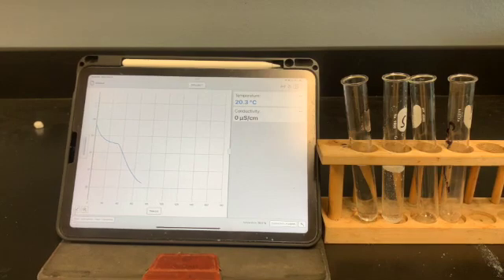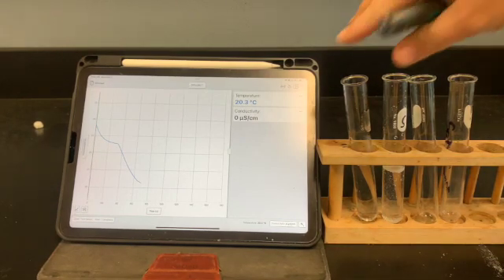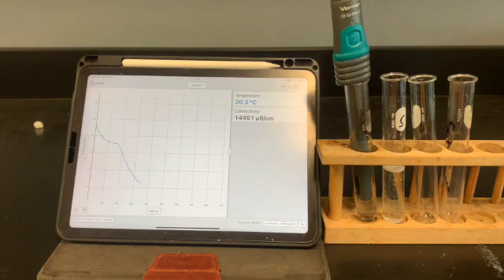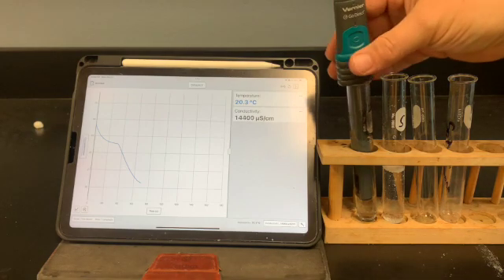Okay, so this time we're just going to get a reading with our conductivity probe. We've filled 2 clean test tubes halfway up, and we're just going to stick our conductivity probe in there. We're going to get a reading, and we're going to record it. Do that for each of the samples you have.